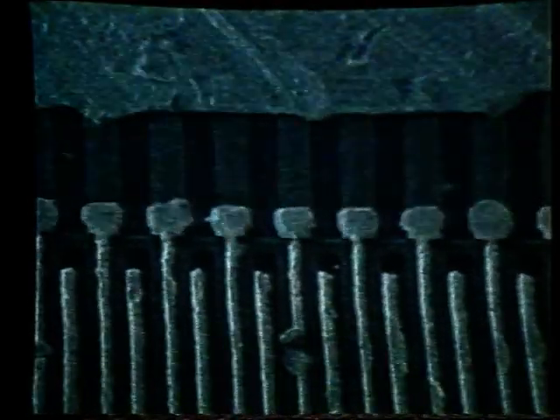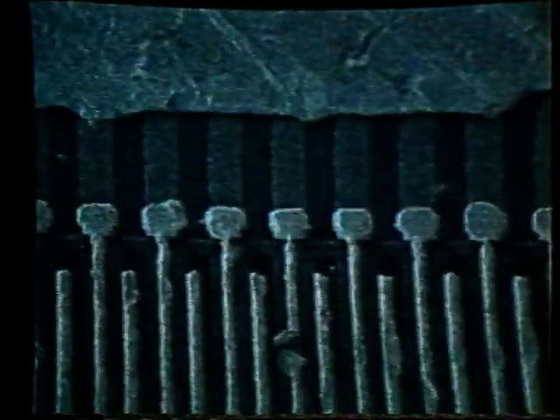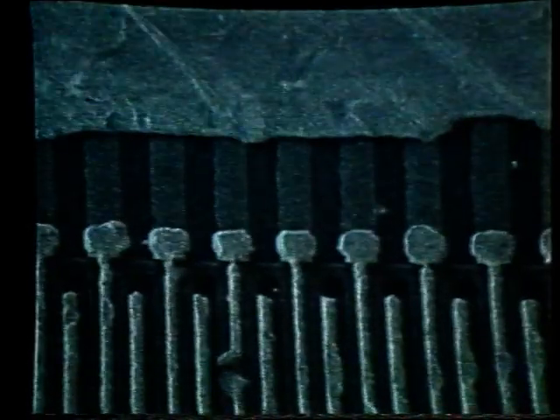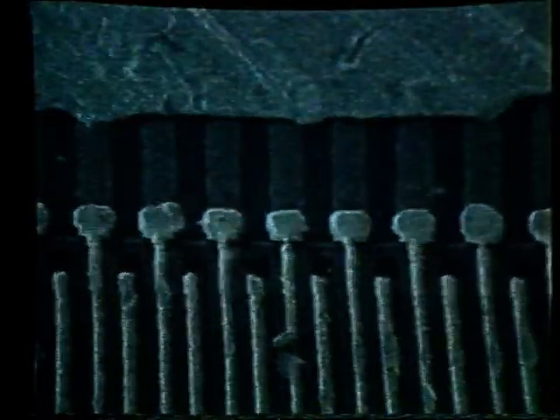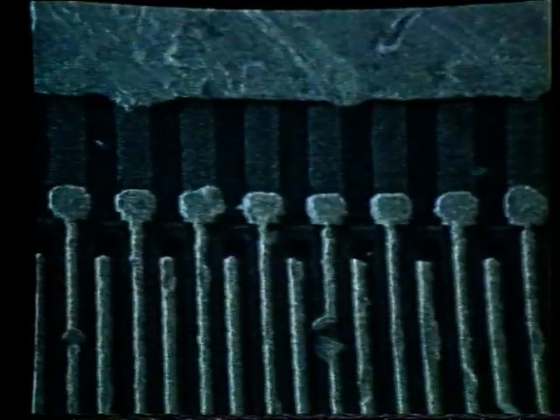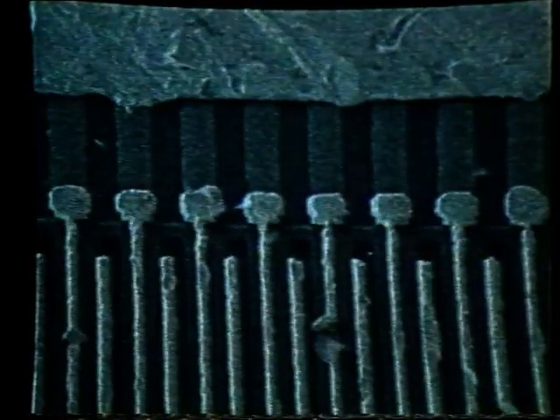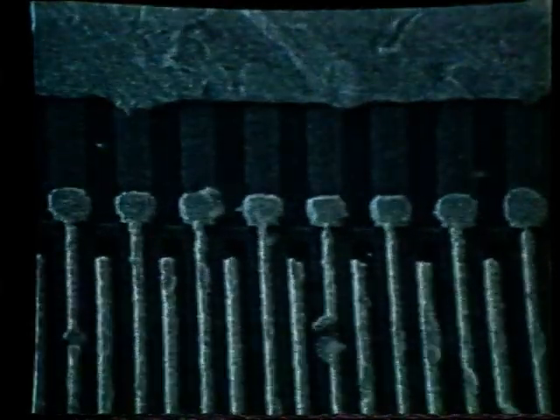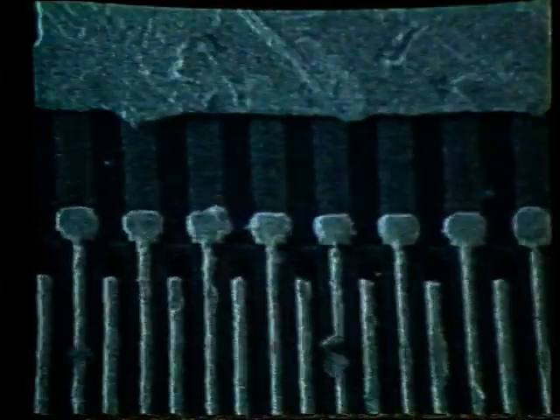So what we will do is slew first the X value, we can see now that the rocking is worse, so we will then slew the X value in the opposite direction. And we have now minimized movement in the X direction, but we see that we have movement now in the Y direction. We will now slew the Y value to try to minimize that movement.